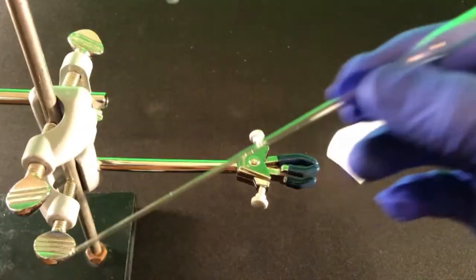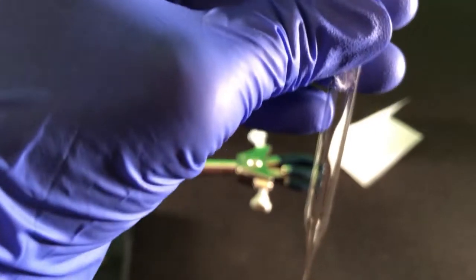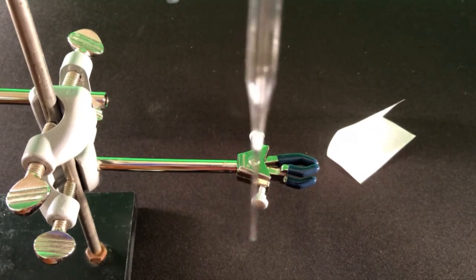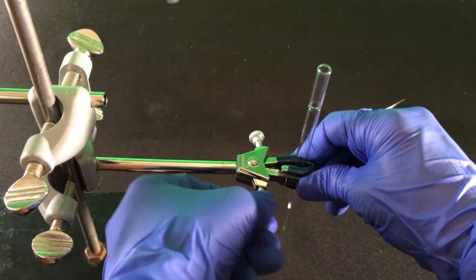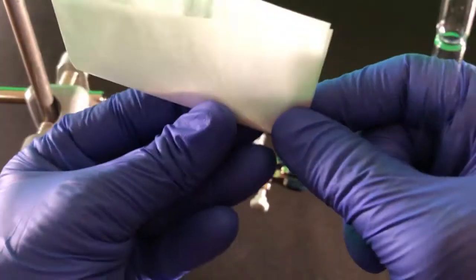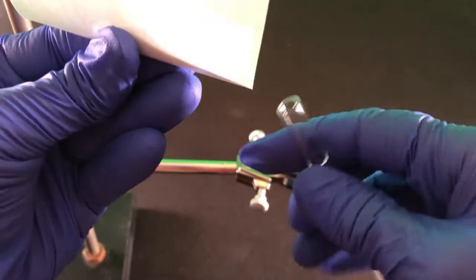Use a long Pasteur pipette to push the cotton into the smaller pipette. If too much cotton is used, it will take a very long time for the organic layer to elute or pass through the column. In addition, if too much water is present, the flow of solvent will stop. Use a piece of folded weighing paper to transfer the sodium sulfate to the pipette. Try not to be as messy as I was. Doing this over a trash can is a good idea.